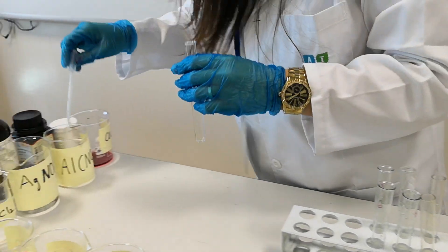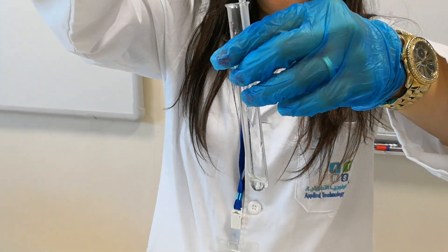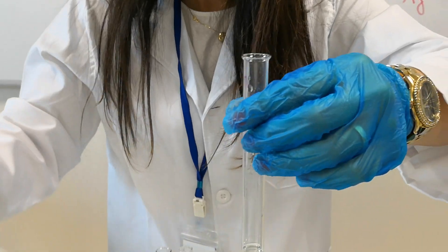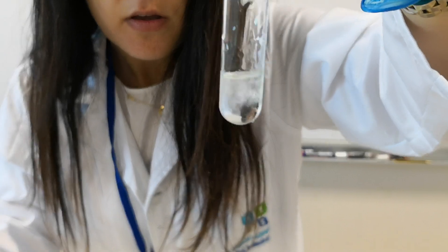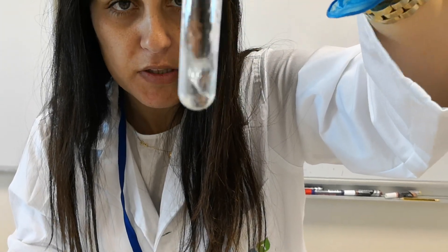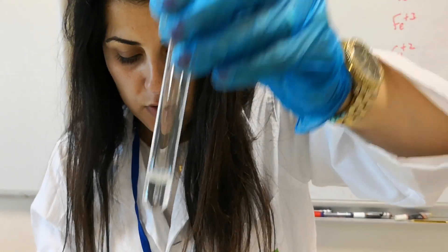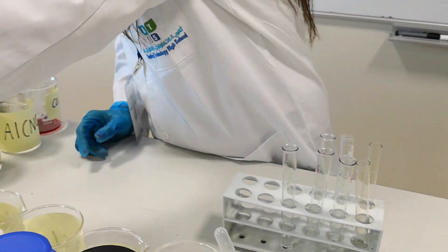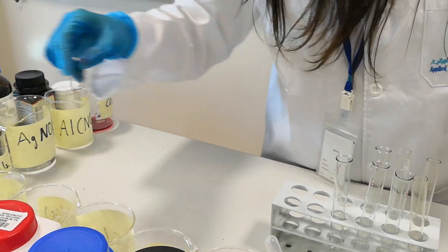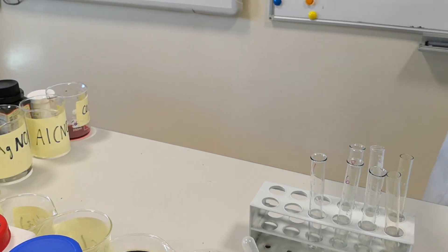Now the aluminum. This is aluminum solution with the sodium hydroxide — it gives a white precipitate. But if I add excess sodium hydroxide, it redissolves again. So we will note it as a white precipitate when adding drops, and differentiate it from others by adding excess sodium hydroxide, which causes it to redissolve. Now let us try the lead and start with the transition metals.